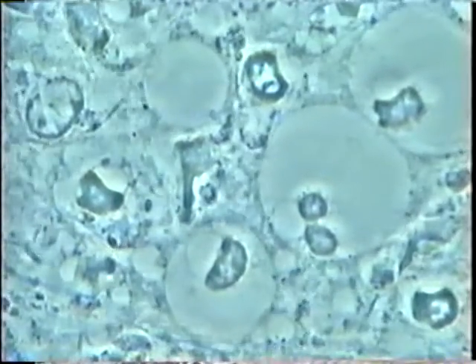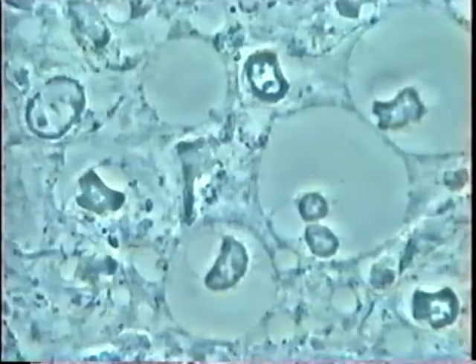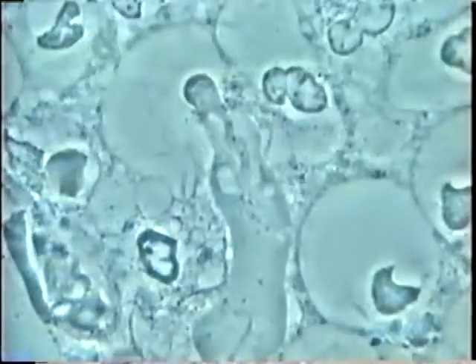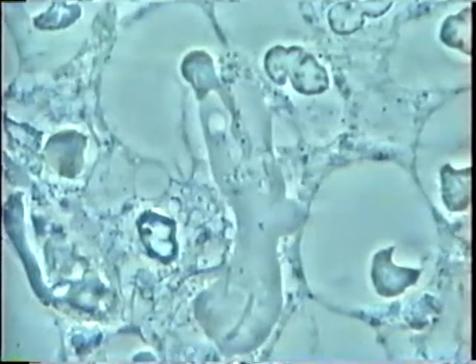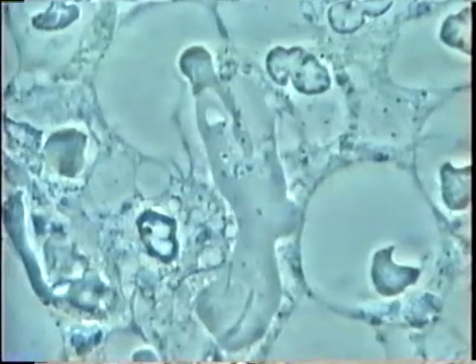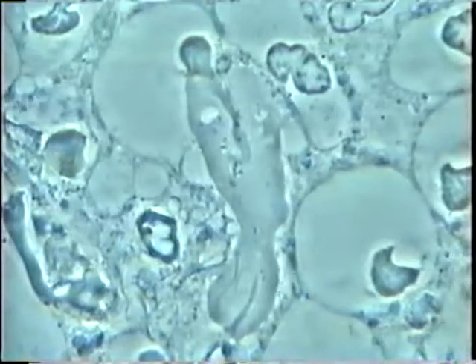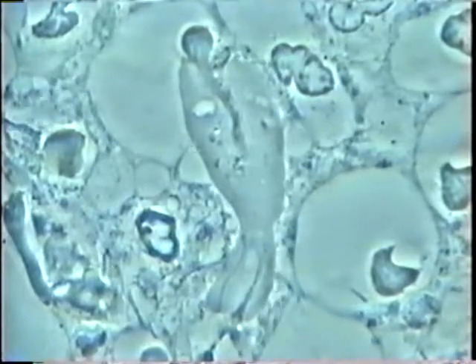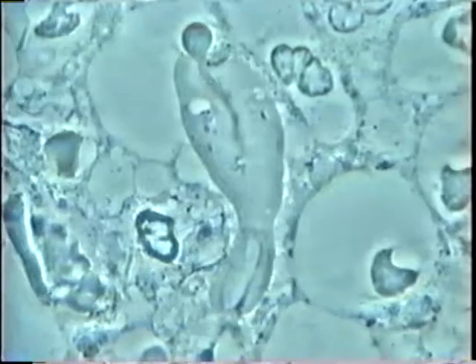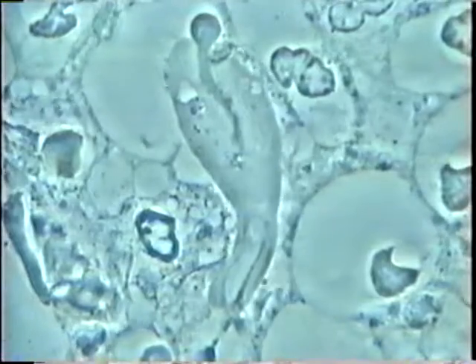This pus is inside the biofilm around your gum and it is destroying your bone around the teeth. If you look carefully, you see many many white cells, and now in the center you see the typical activity of the parasite amoeba, whose name is Entamoeba gingivalis. At the top you can see it is eating the nucleus of a white cell — this white cell has few granules, as if it has been anesthetized.